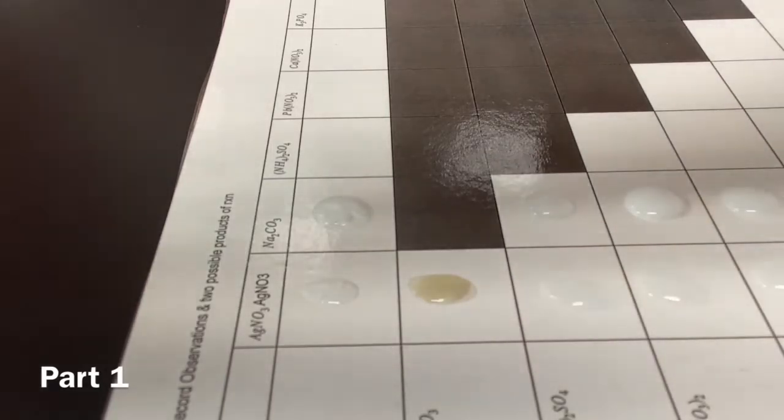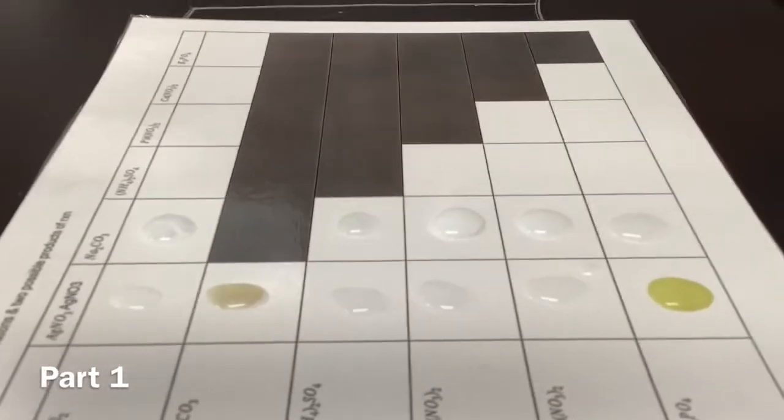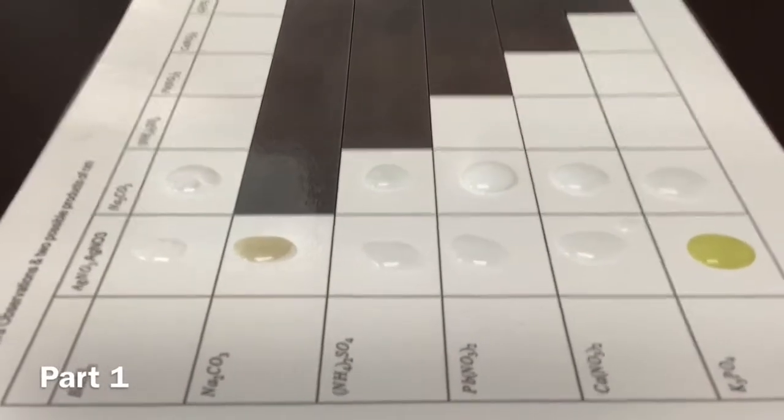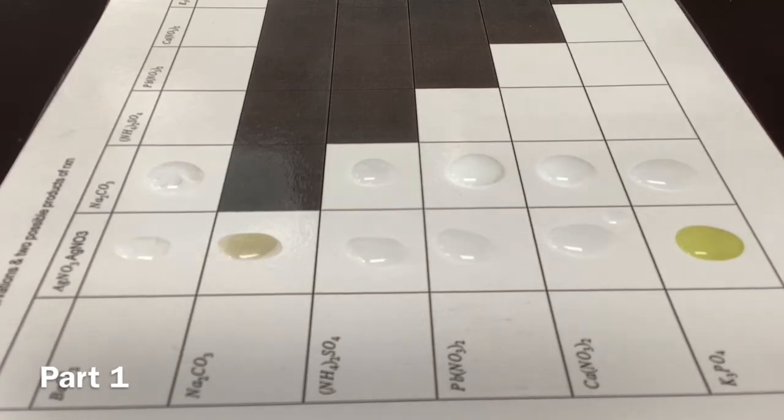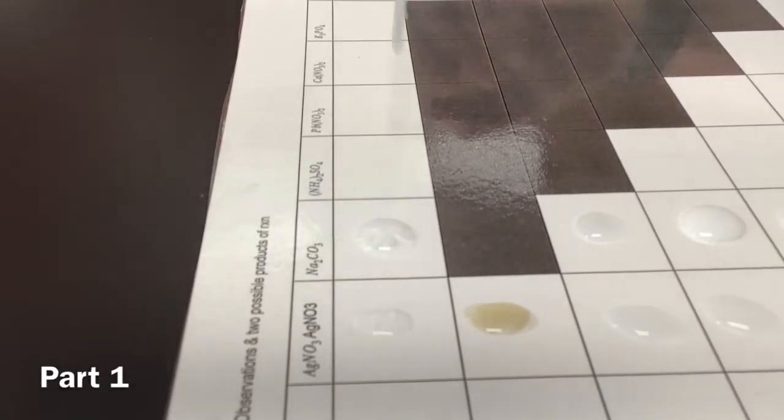All right. So just make sure you wrote down all the stuff here, and then if you want to right now, you can also write down what the reactants were, and then we're gonna keep going. Well, these are all different. Oh wait, they are different colors to start with. All right.